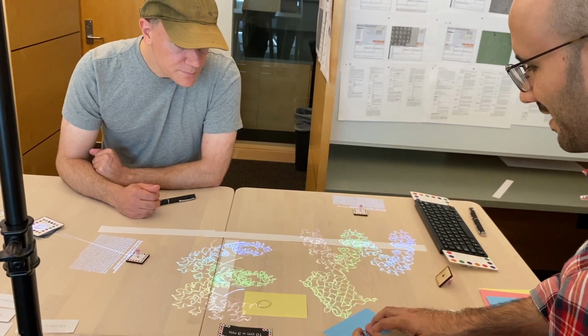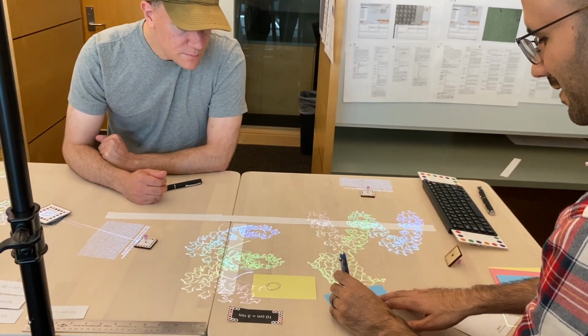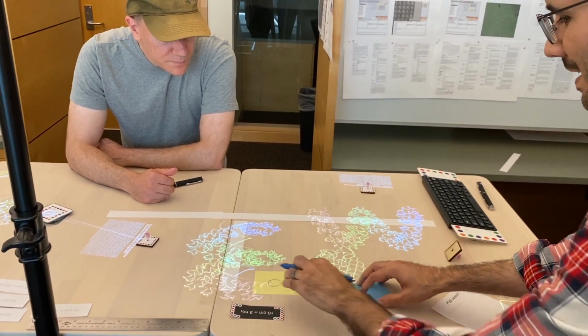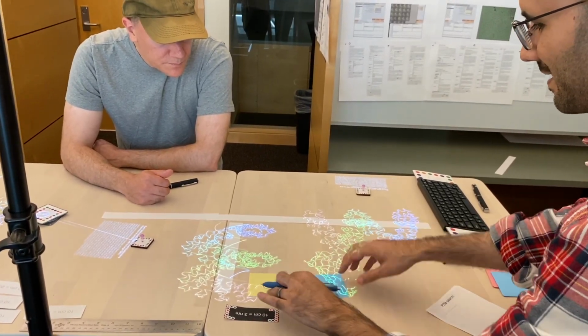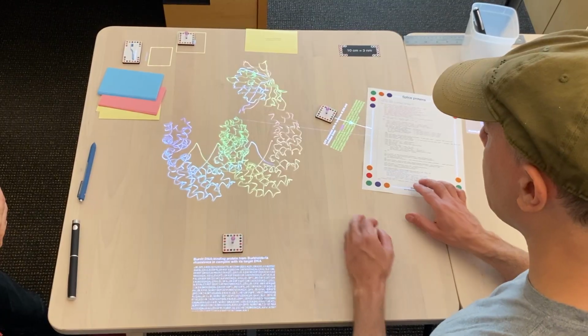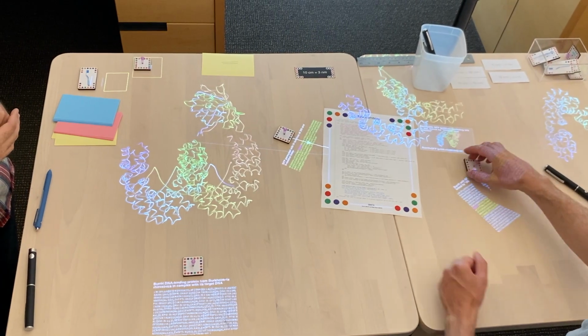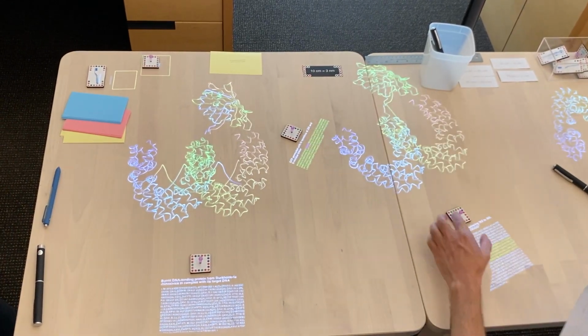Here, Shawn is showing me a more complicated idea that uses two BurHs and a spycatcher spytag system to pin the GFP down in two places. And he's kind of just doodling on the table. So that's a future project, but even now with one BurH, we don't know which splices will actually work. So here we're trying a different splice point and saving it off into its own tube.